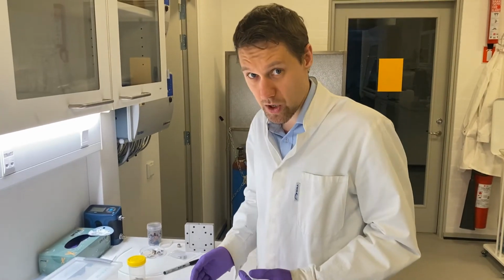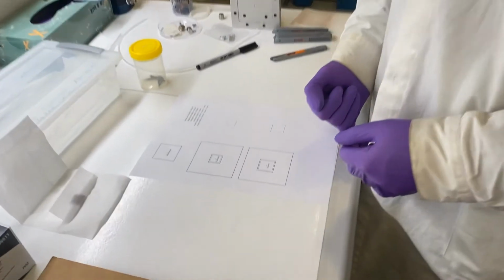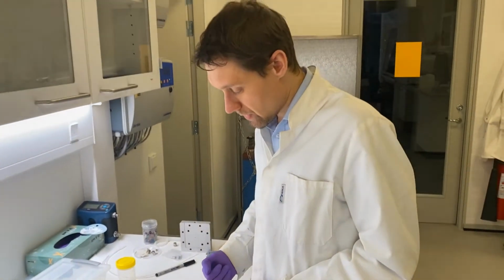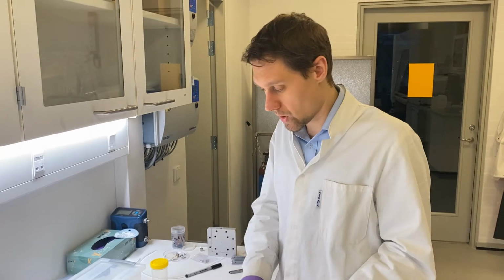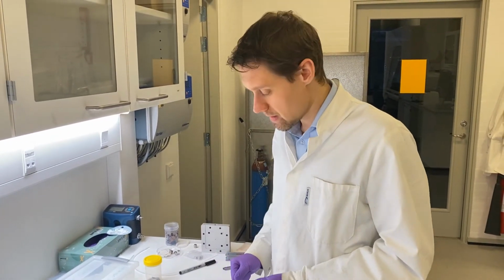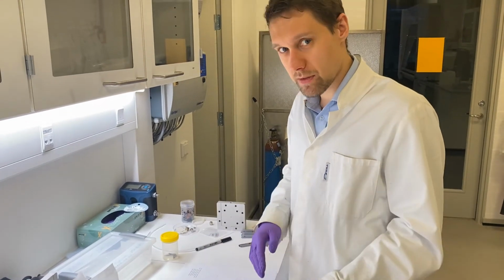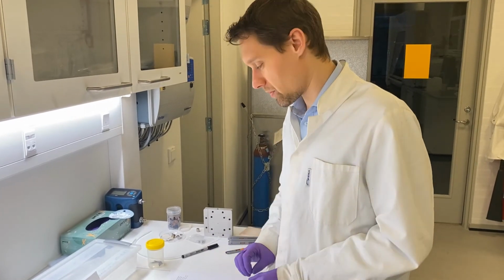So we've just cut the cathode, which was a copper cathode, and now we are getting to the anode. And for this, we'll be using iridium dioxide. And the reason I'm cutting it in this direction is because we do not want iridium dioxide on the cathode side, because that is a good catalyst for hydrogen evolution, which we do not want. And if I did so, I would need to clean everything and take on new gloves. Doing it in the opposite way, cutting the cathode first and then the anode, is not as problematic.